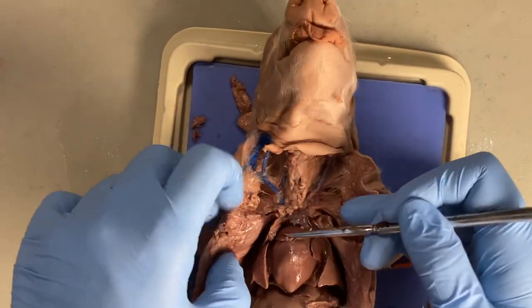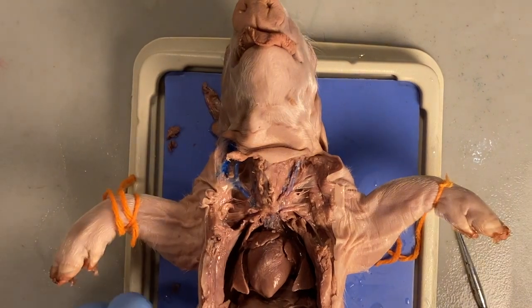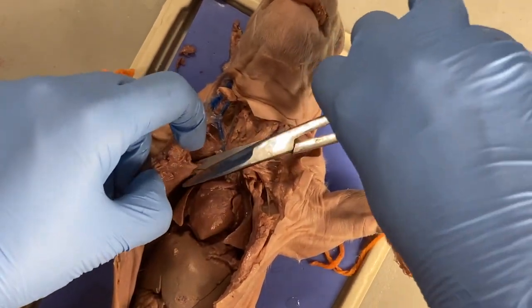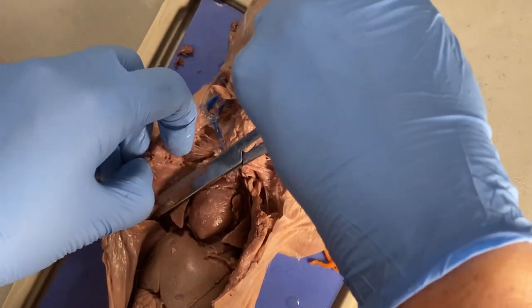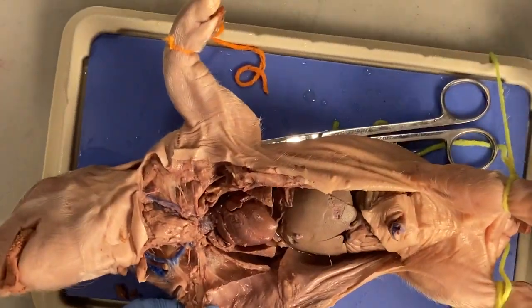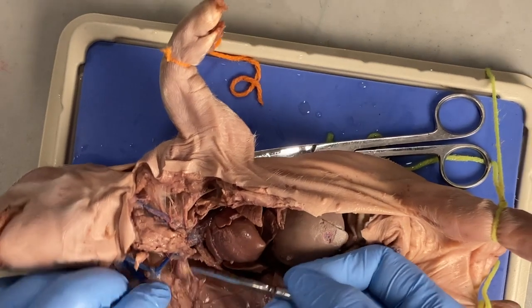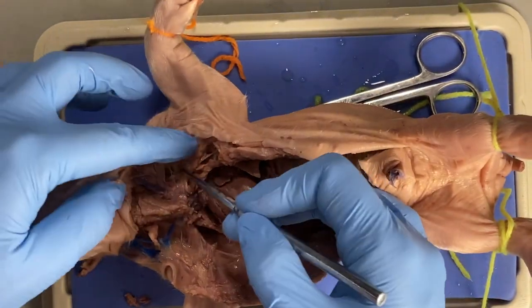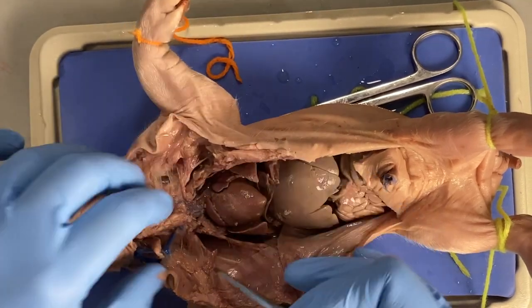I'm making slow but steady progress, and sometimes you might want to remove more of the rib. I'm going to cut this at an angle, which will allow me to really see on the inside. This takes a little bit of time, so I'm actually going to shut the camera off for a bit — but all I'm going to be doing is looking and finding the connective tissue, separating the vessels from the connective tissue.